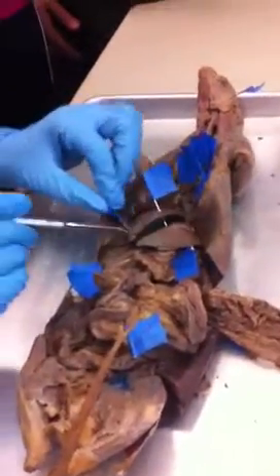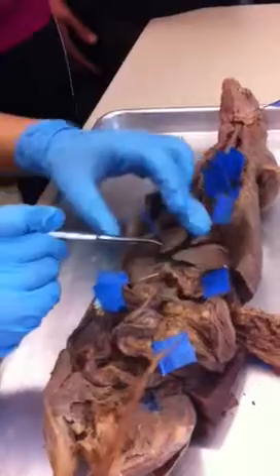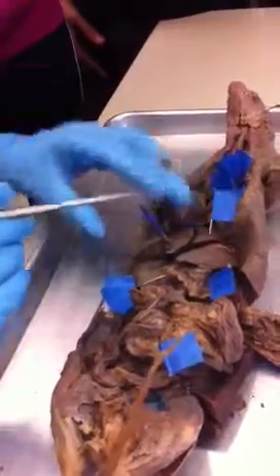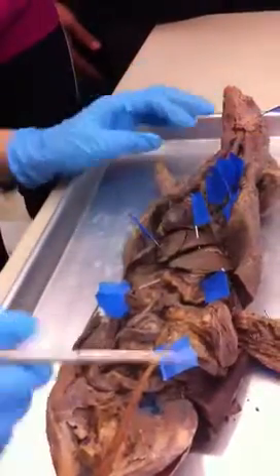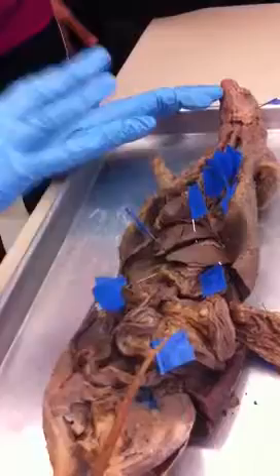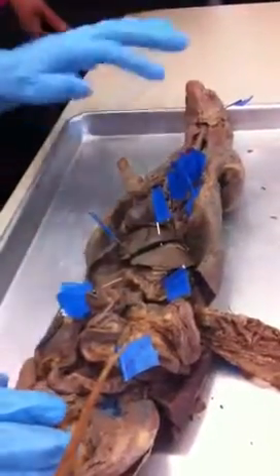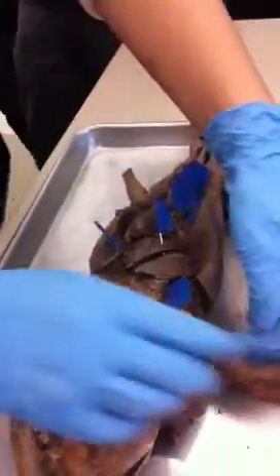And then liver, gallbladder — these things here, inside there is a sac, you can see. That's the one. It's very clear here, and you don't need my explanation. All the things are already labeled here. You take a look by yourself.